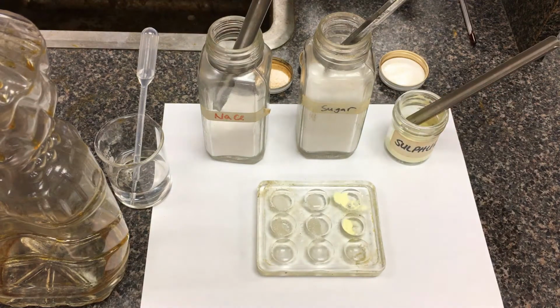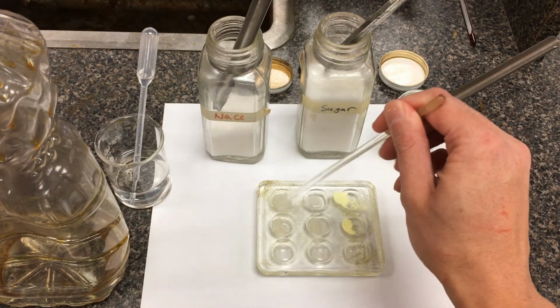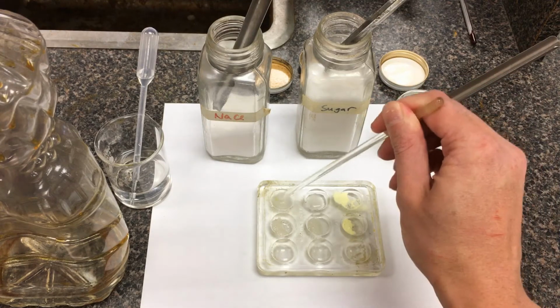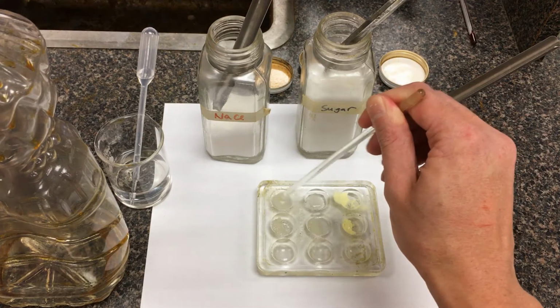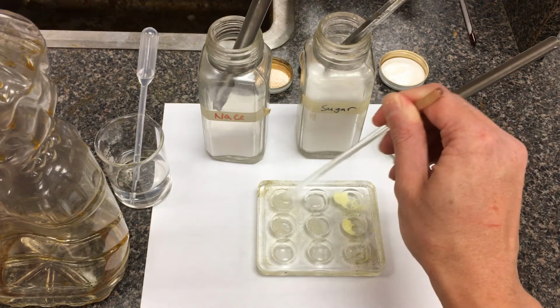Okay. And then again, what we're going to do here is investigate whether it dissolves or doesn't dissolve. So I do have 6 different stir rods here, so we can mash up a little bit of the powder. So this is table salt and a little bit of water. Okay. This part shouldn't really surprise you. Toss salt in water, should have no trouble dissolving there. It's possible if I toss in too much of the salt, you might actually saturate the solution, but because sodium chloride is very, very soluble, I would expect this to be fairly soluble.